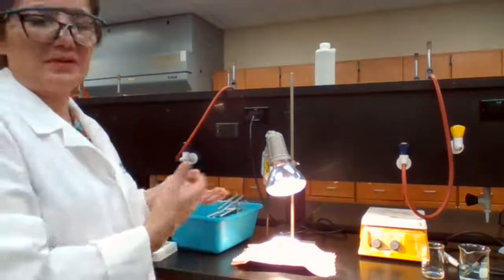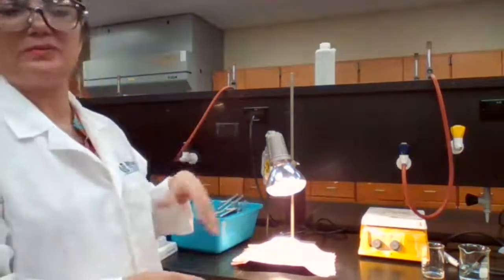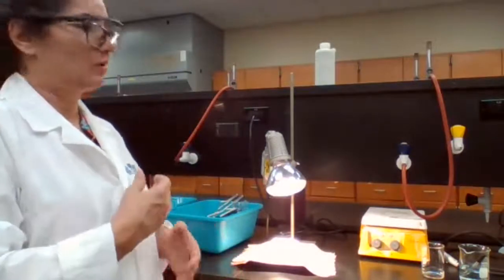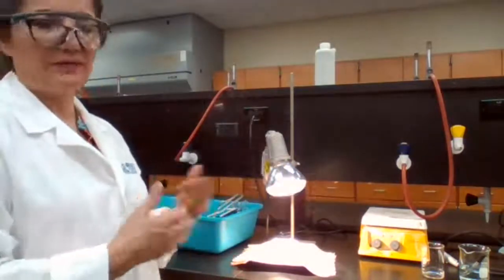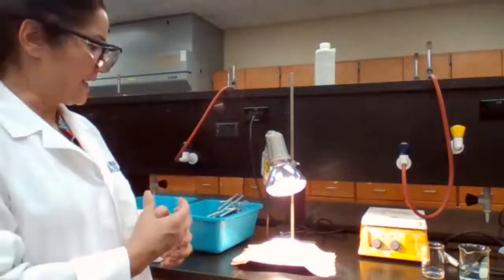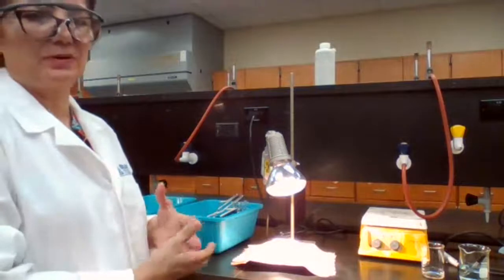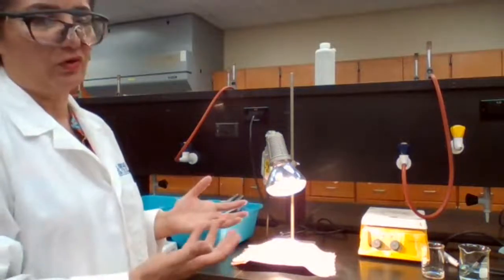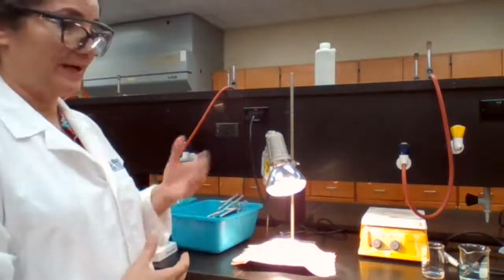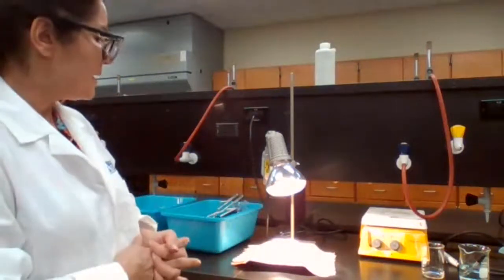If we get less than 0.5 gram, that means we lost the copper somewhere. When we were decanting, or we didn't add enough sodium hydroxide, not everything precipitated, or we lost it when we were washing, different steps. So if you watch the video, you can predict and find out in which step I was able to lose the copper, in what form. Either the precipitate did not form, or I lost it when I was decanting.